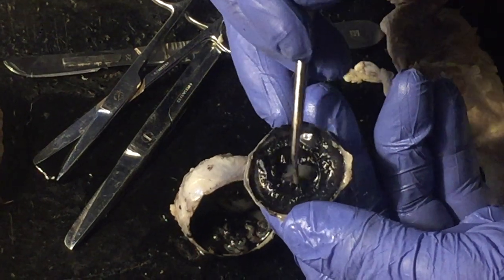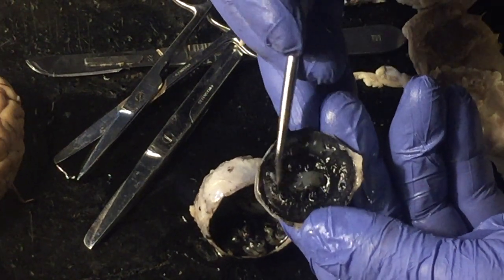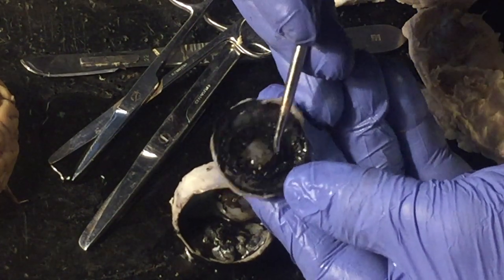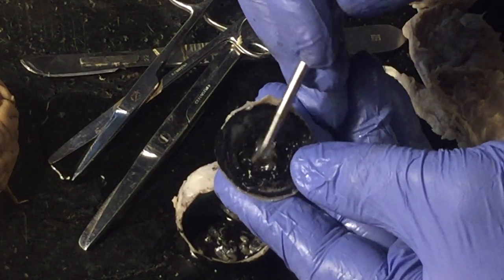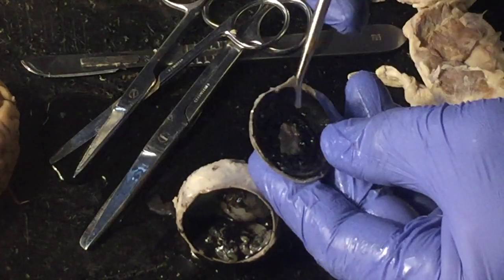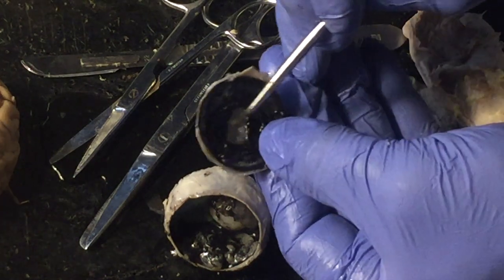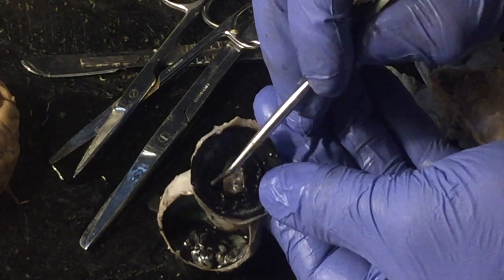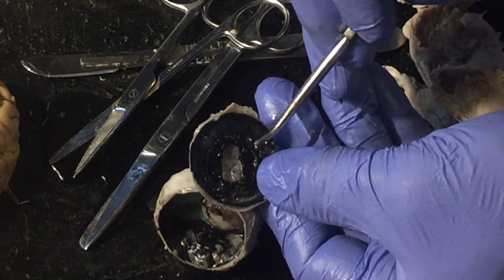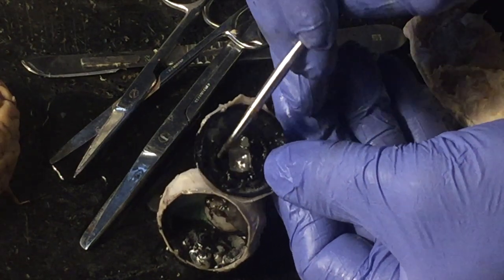Now, Beck, I'm not sure how well people can see this, but this hole right here would be the pupil of the eye. The iris, the colored portion of the eye, would be right here. Of course, on cows, they're black. They're very dark colored.